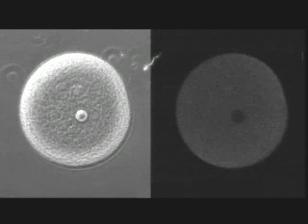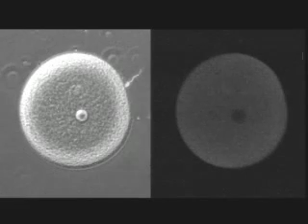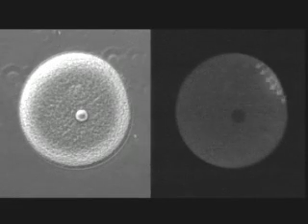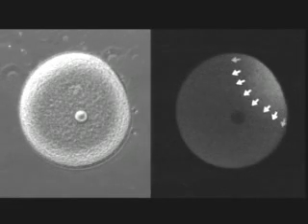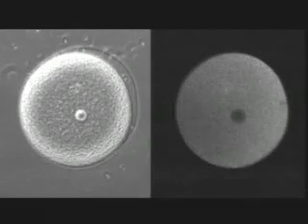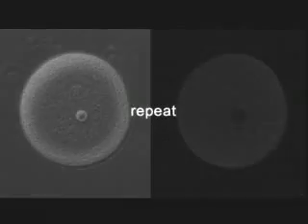When a sperm cell fuses with the egg, the fluorescence image shows a wave of calcium ions that sweeps through the cytosol, starting from the initial point of sperm-egg fusion.